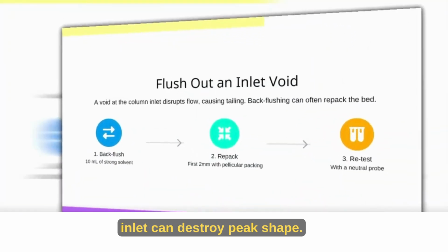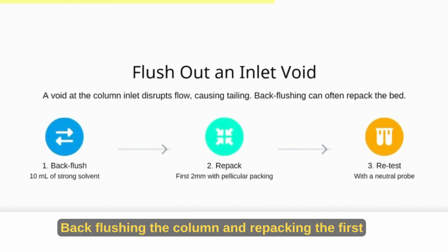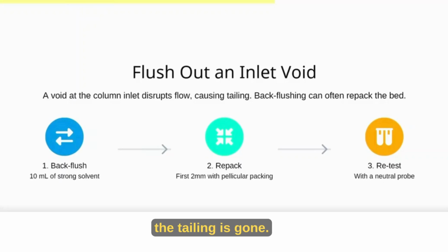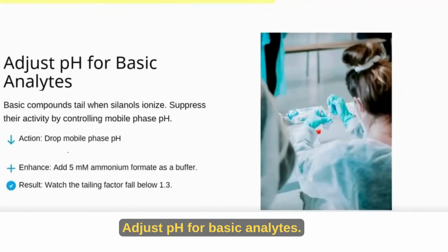Flush out an inlet void. A small void at the column inlet can destroy peak shape. Backflushing the column and repacking the first millimeters often restores smooth flow. Always retest with a neutral probe to confirm the tailing is gone.